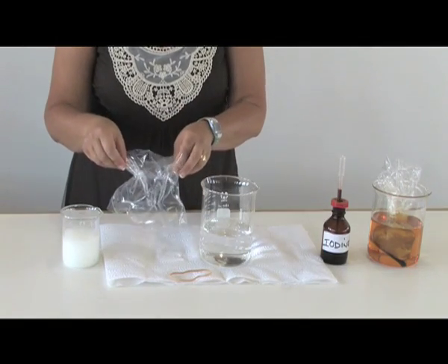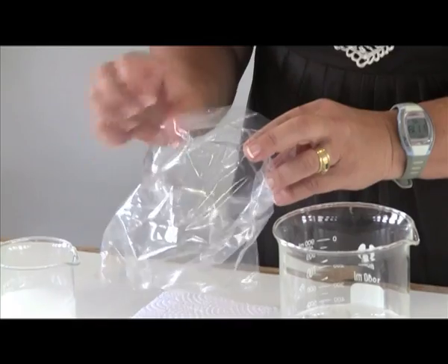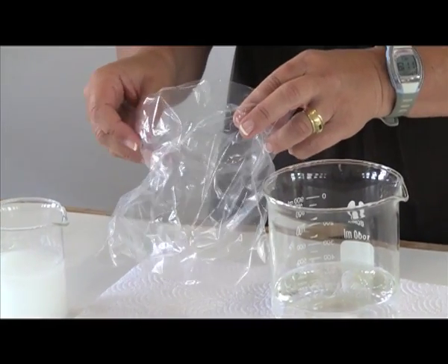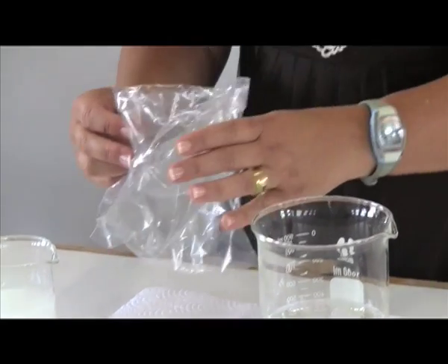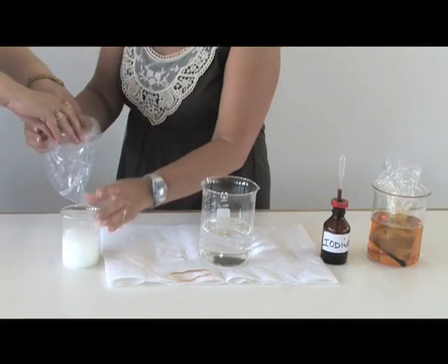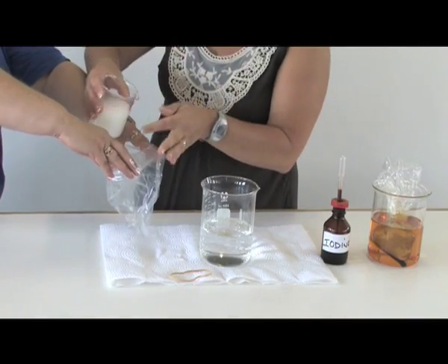You would then need a normal sandwich bag or freezer bag, and what I am going to do is pour this starch solution into the plastic bag.